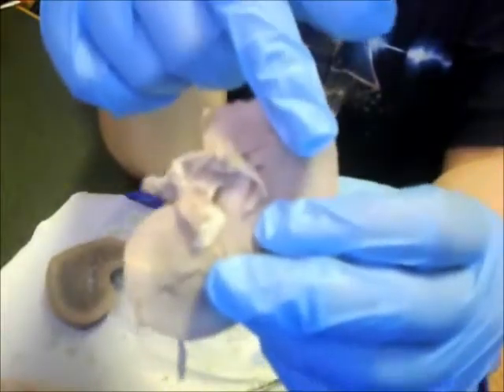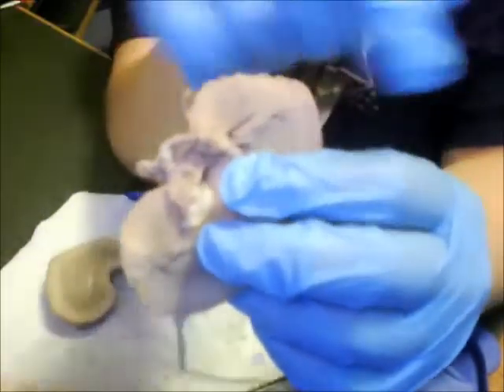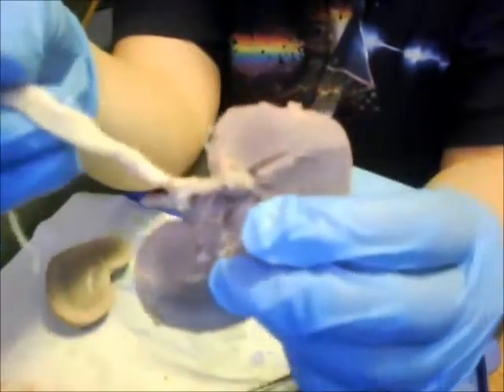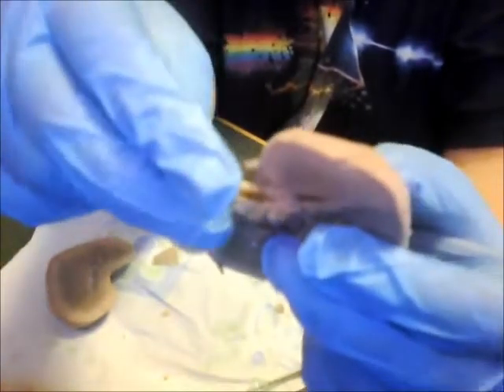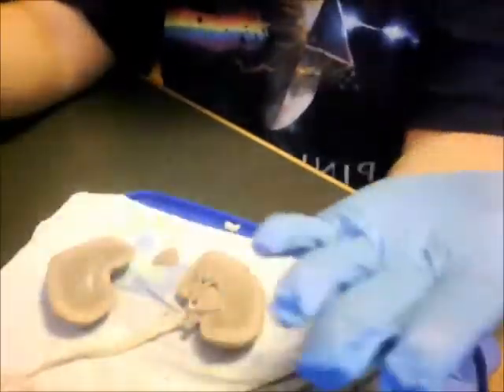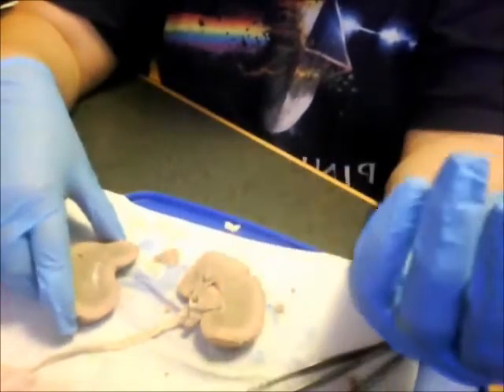and then if you go up towards the medulla region more, this is where the filtration system really occurs, because you have the loops of Henle, and it has a very, very organized system of how it filtrates. And there's other ways that we excrete as well. We can obviously excrete by releasing stool, or you sweat or perspirate. You can also excrete by inhalation, exhalation of carbon dioxide.